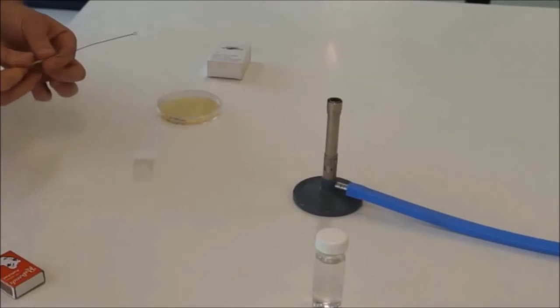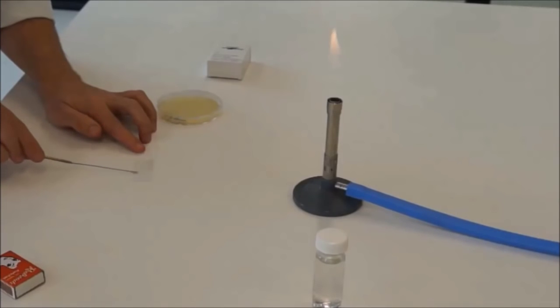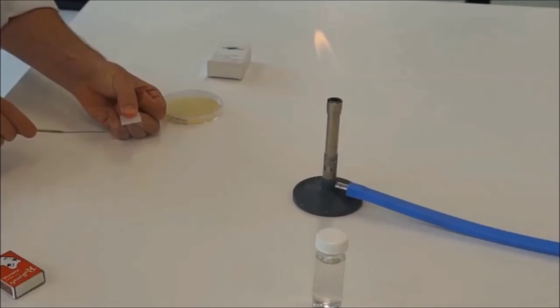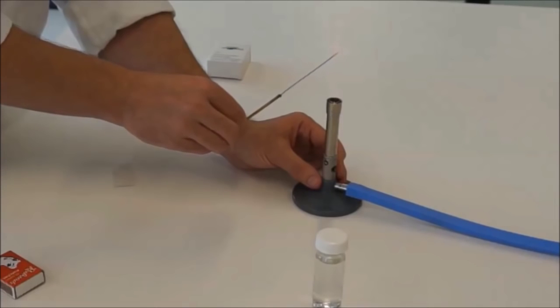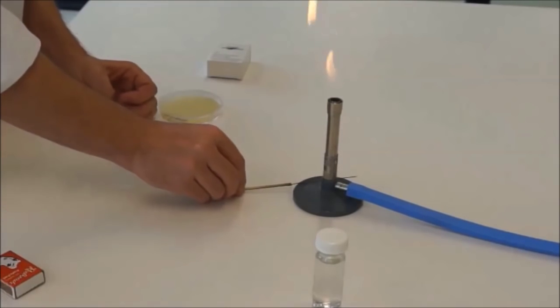And now here's a very important part. Get that water and spread it out all over the slide as far as you can. You'll want to leave a little area so you can hold it. So in a minute you'll dry all the water off with the Bunsen burner. Spread this out probably at least three quarters of the way along the slide. One last heating of the loop. Now this is really hot. You don't want to put it down anywhere it's going to burn. So a really good place is on the metal of the base of the Bunsen burner.